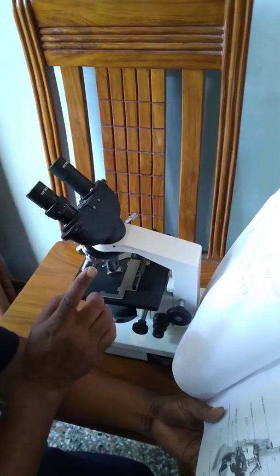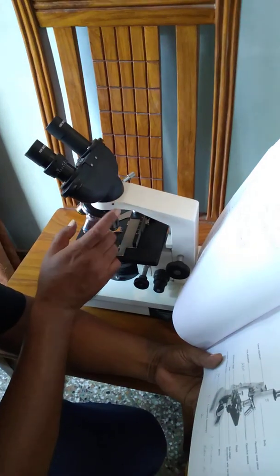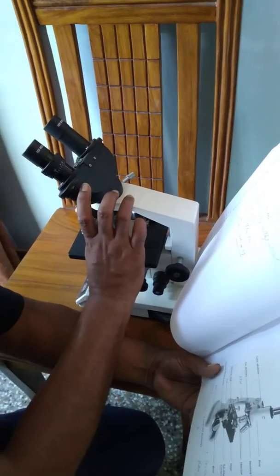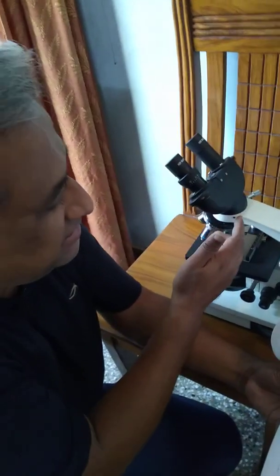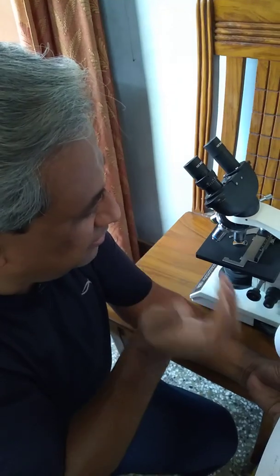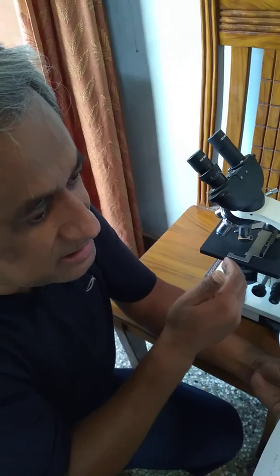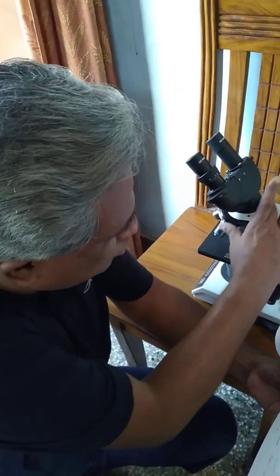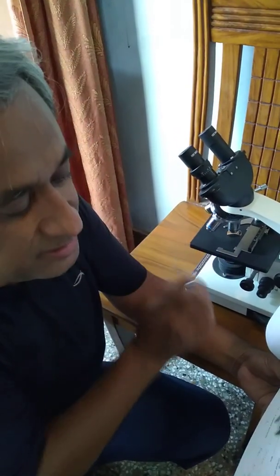Here the body tube is using a prism. It may be using a prism or a reflector, but here it is absolutely using a prism, and the body tube is being diminished in size. The eyepieces are so angularly set that there is a prism apparatus for the reflection. You know from physics the principle of total internal reflection of light: keeping a right angle prism, you can reflect light onto that. That is a different thing; you will be reading about it in class.